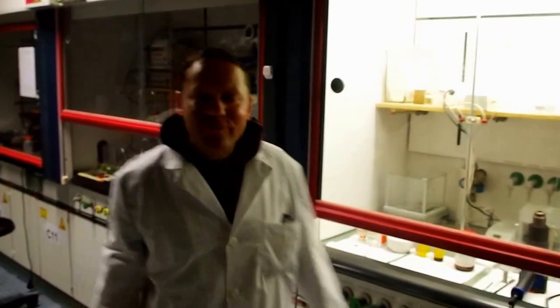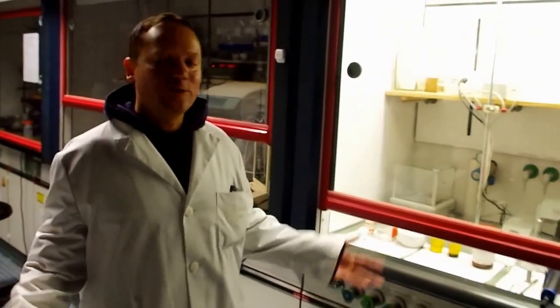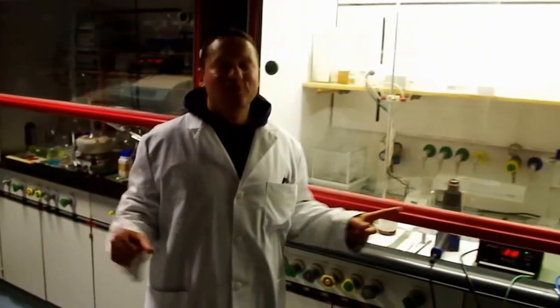Hello, my name is Frank. Today I want to show you how to make blue light emitting cadmium sulfide nanocrystals. Basically, it's like cooking. So what you see today is a lesson in nano cooking.